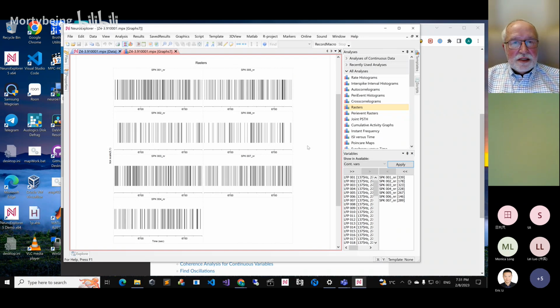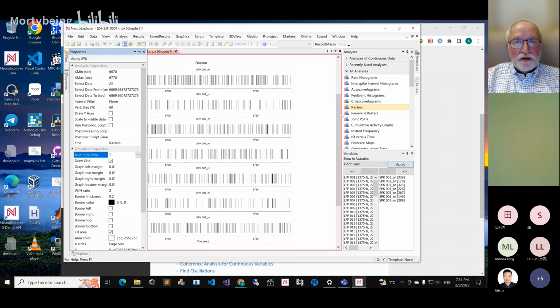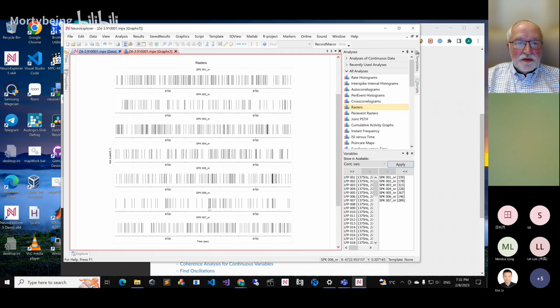Why are we choosing other options in your first step? Because the customer wanted to show the rasters in one column, one above another. To do this, we can go to properties and graphics properties. Number of columns. Now it's automatic. We can change it to one and apply. So now we have all of them, one under another. So that's the idea.